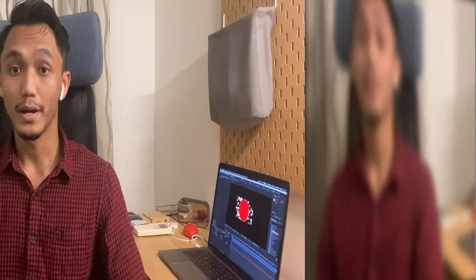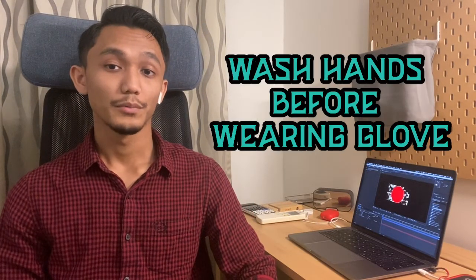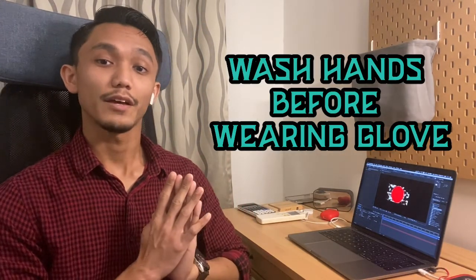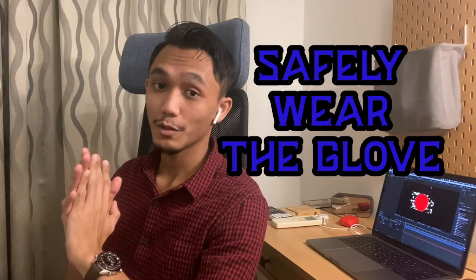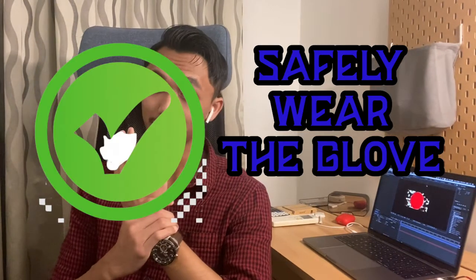When we enter the changing room, we will quickly change into our PPE. Firstly, we will wear our shoe cover. Next is face mask, and then cap, non-sterile gown, and then glove. But before we wear our glove, we will wash our hands using the 7-step hand washing techniques. Here are the techniques. After we are done washing our hands, we will start wearing our glove safely.